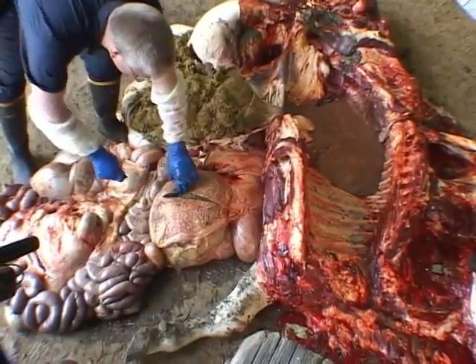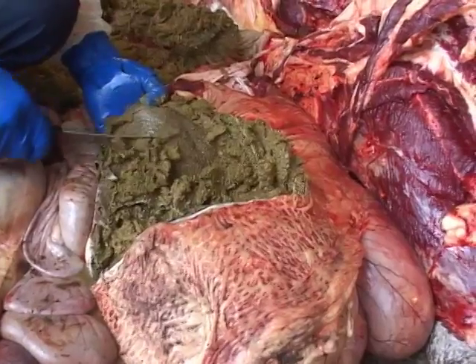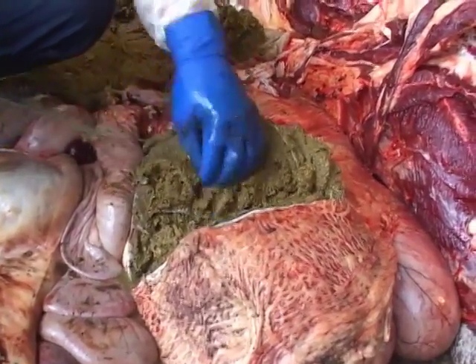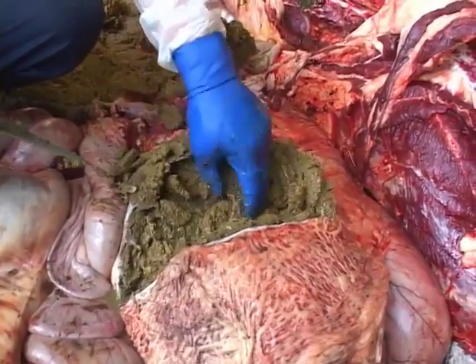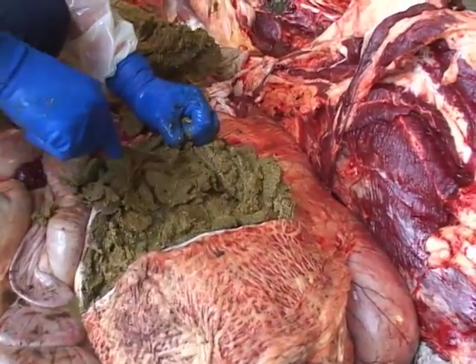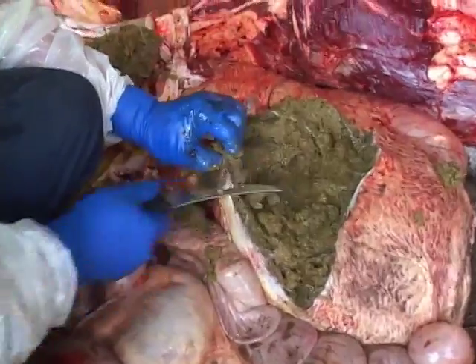Open the omasum. These contents are very dry and distributed throughout many leaves. Inspect the mucosal surface of several leaves and collect a sample for histology.